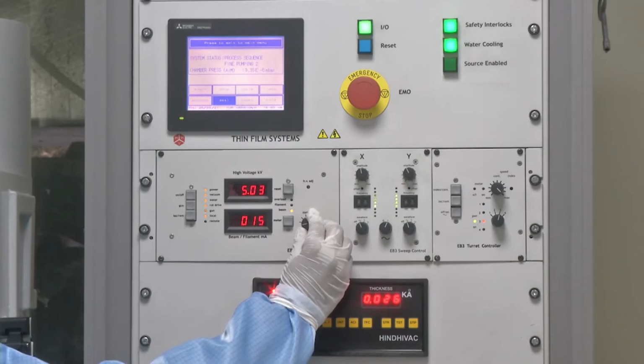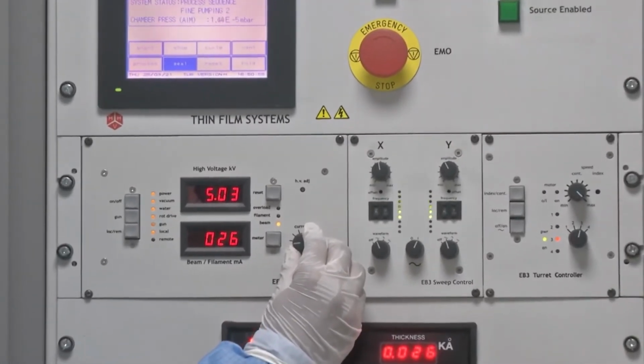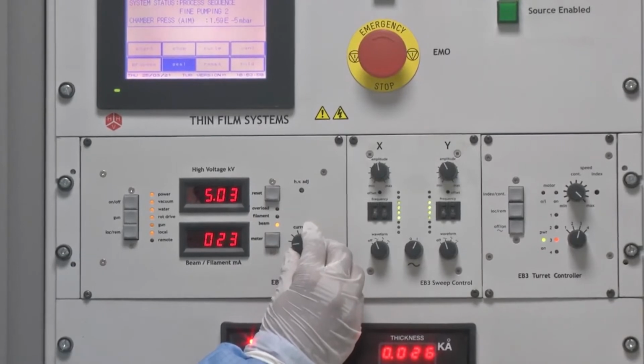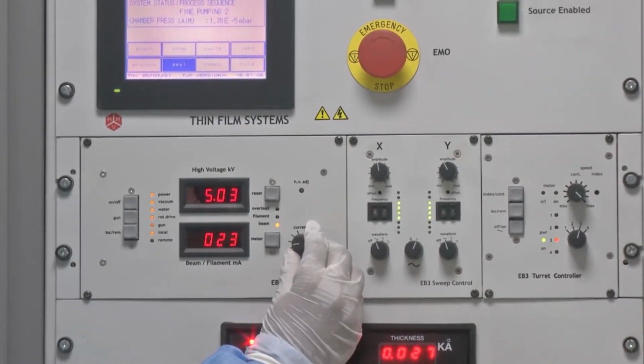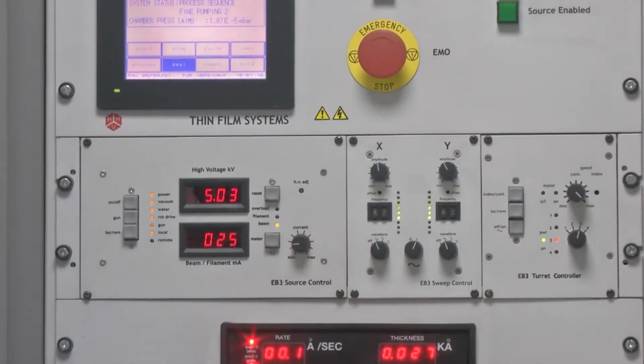These two times, which is increasing the current up to a certain level and then keeping that current constant at that level, are called rise time and soak time respectively. So, rise time is the ramp up time, which means you increase the current up to the set point and then at that set point you maintain the current level for a desired time, which is obtained after several optimization cycles.